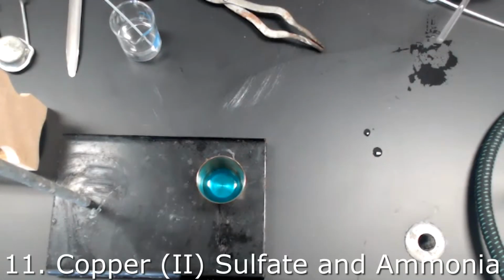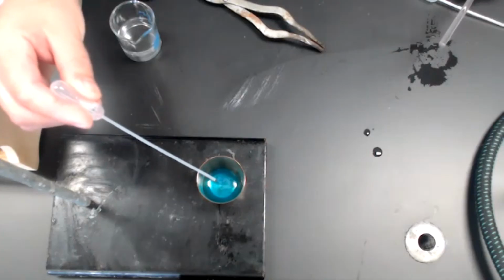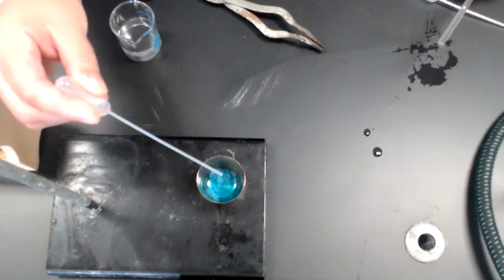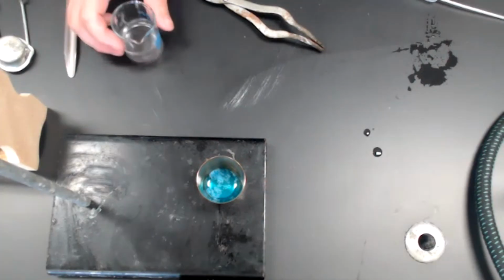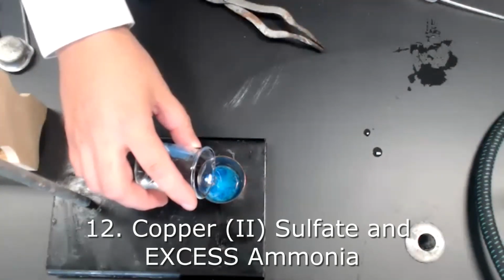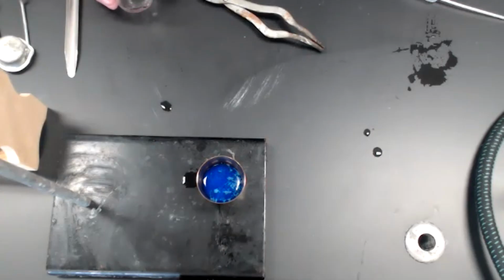I'm going to add a limited number of drops of ammonia. Notice the change. I'm now going to add an excess of ammonia. Notice the change.